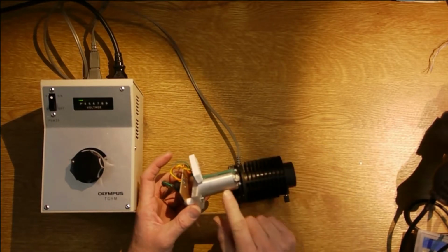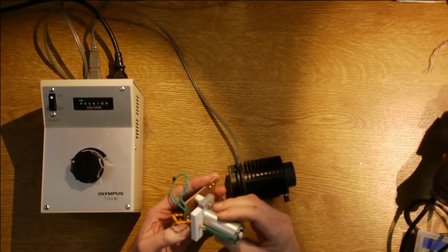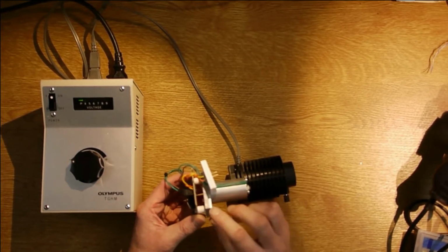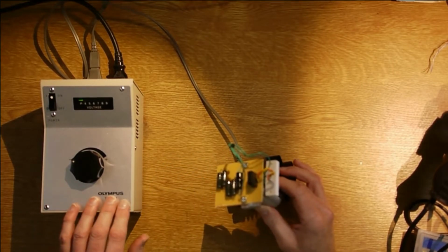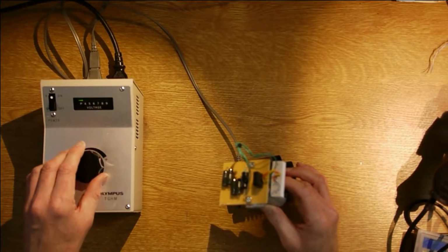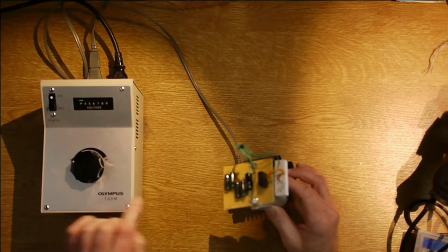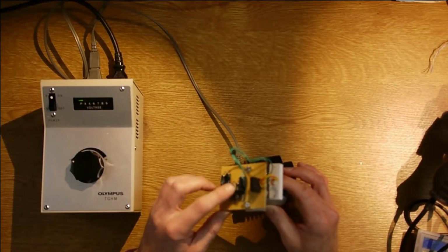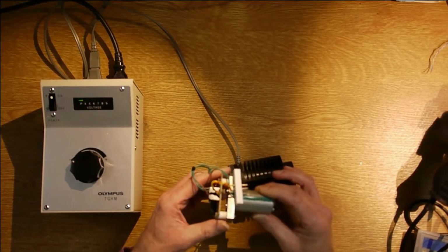This is also a heatsink here, because this LED does get a little bit warm. It doesn't get hot, and this does dump the heat out the back of the assembly. Because this is a variable transformer, it actually outputs AC. So here I've got a bridge rectifier and a capacitor and some dropper resistors, just to limit the current.